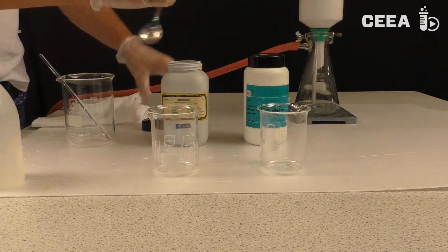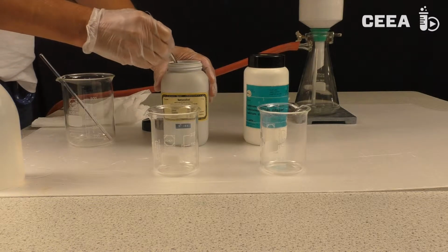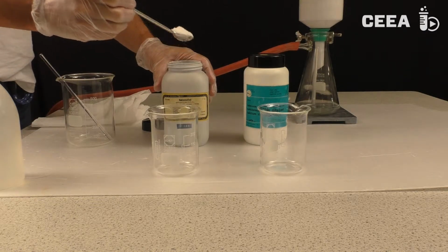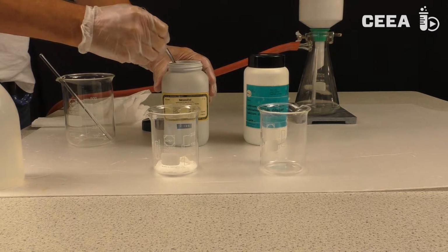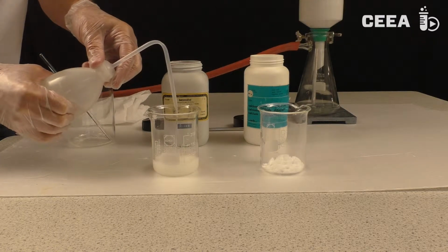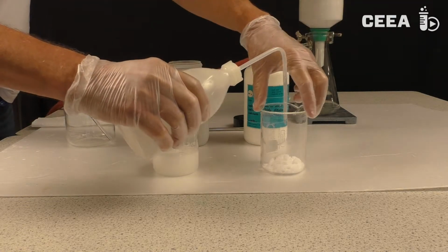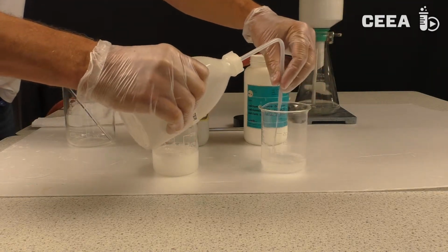any calcium sulfate. If we know how much calcium sulfate we want to make, we can easily calculate the amounts of initial salts to be dissolved. I won't bother you with these calculations, but start with the experiment right away. We dissolve the initial salts in separate beakers.